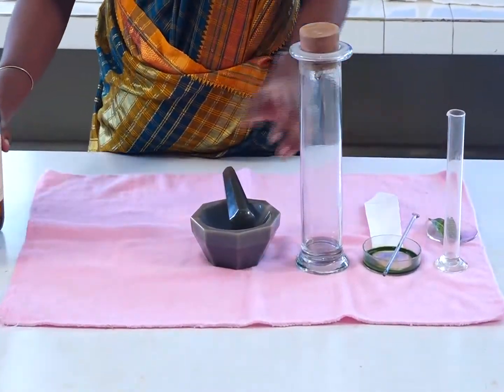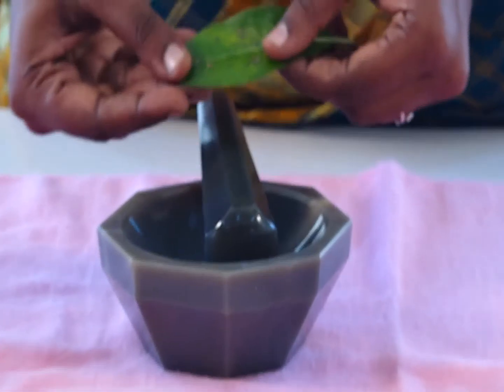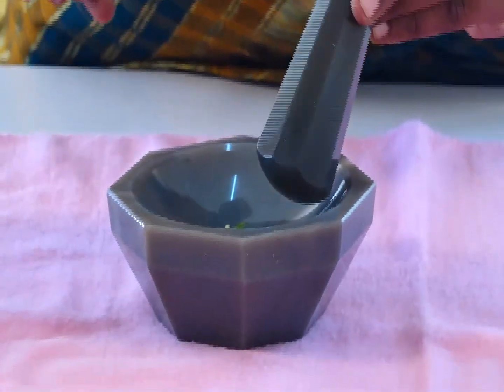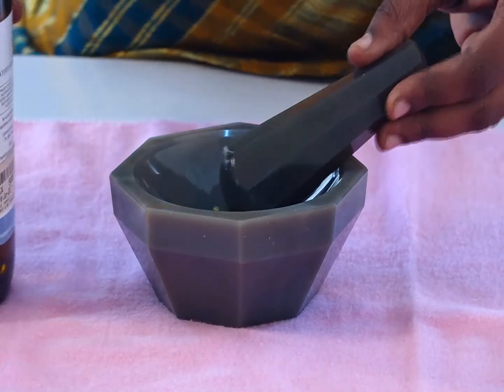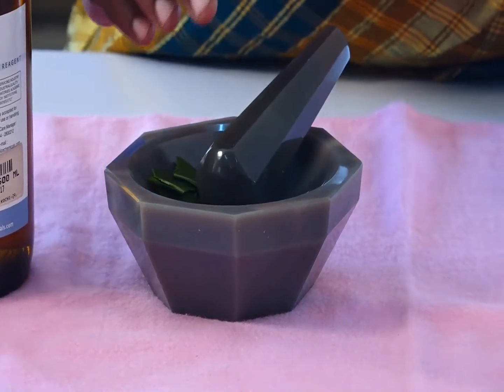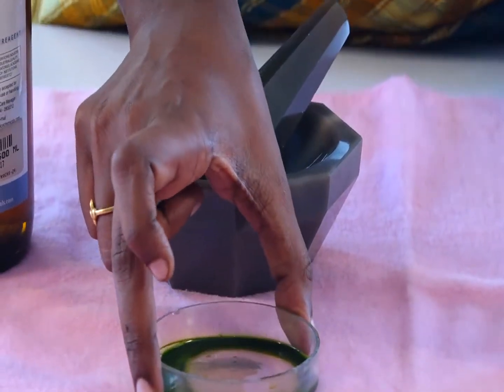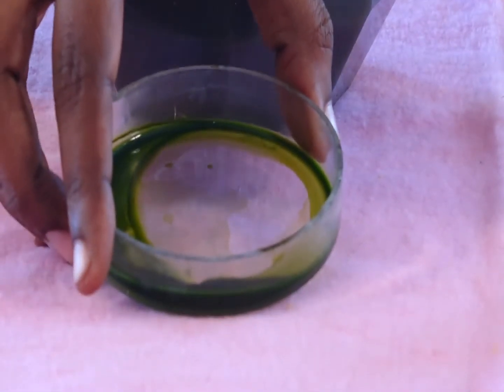First, take the pestle and mortar and place one green leaf, torn into small pieces, into it. Add acetone and grind completely. After grinding, use a muslin cloth to filter and separate only the liquid. This liquid is the pigment extract obtained from the green leaf.